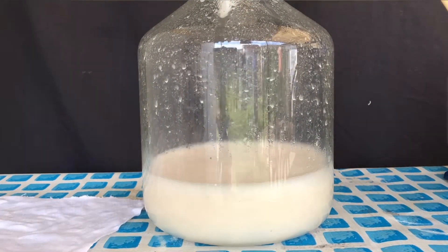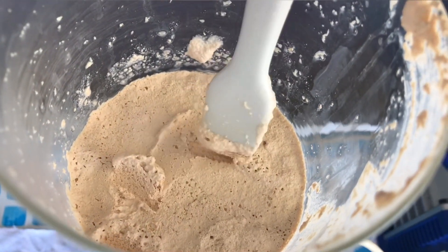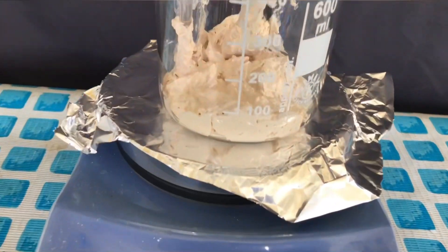As you can see, the liquid still looks like milk, which means that the yields will be really low. If you listened closely, you were able to hear that I didn't filter all of the solution.